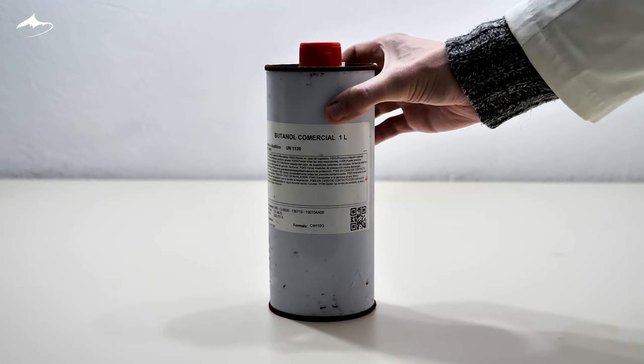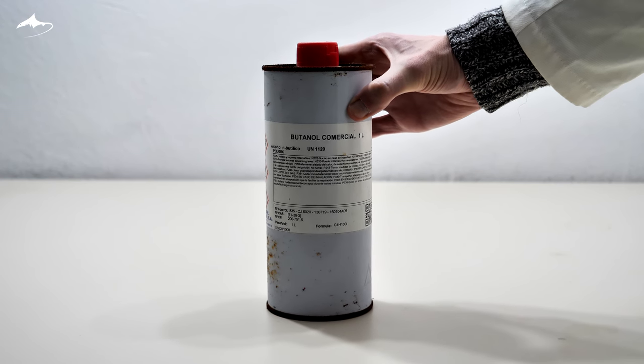Hello, today I'm going to synthesize butyric acid by oxidizing butanol in a mixture of chromate and sulfuric acid.